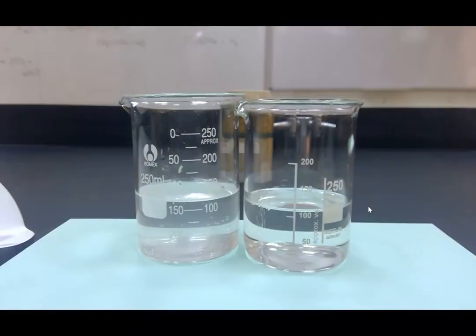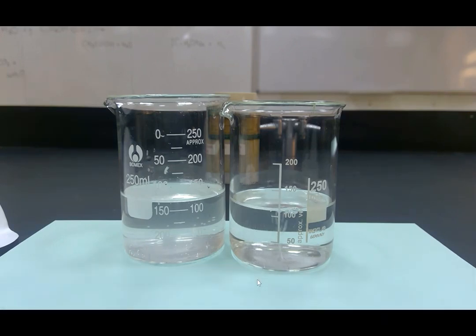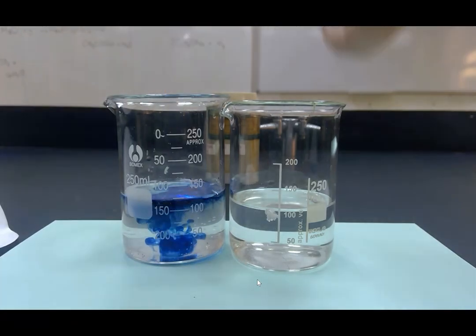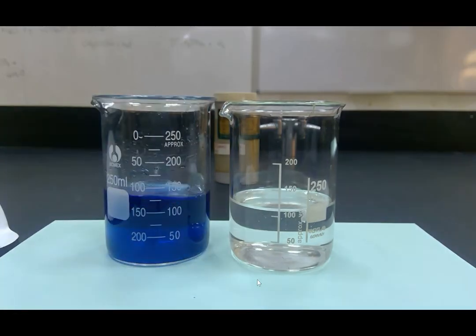In both cases, the product that is being made is an alkali. So if we were to test these with universal indicator, they would both be a dark blue or purple in colour. In the case of sodium and water, we know that our product should be sodium hydroxide and that is a strong alkali. And as predicted, we get that blue colour that shows us that a strong alkali has been made.